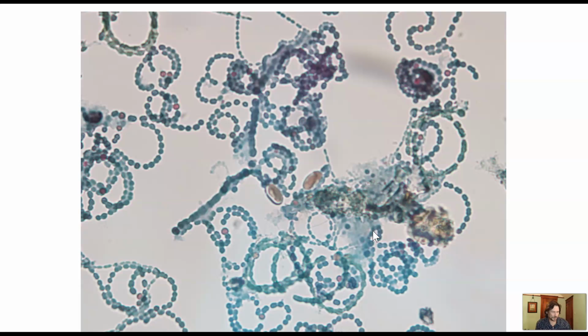Another view, so take a look. And so here, those are our heterocysts. In this prepared slide, they're staining pink. Then we have the much larger akinetes. And then all the other cells would just be the somatic cells. So those are 3 types. And so that's our Anabaena. Really common organism. So if you go out to ponds around here, you can pull up a lot of this stuff, right? It makes kind of like long threads.